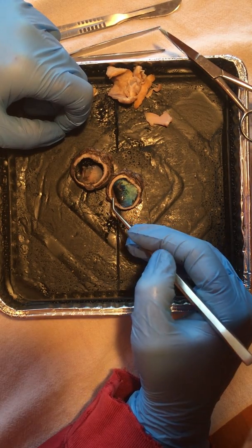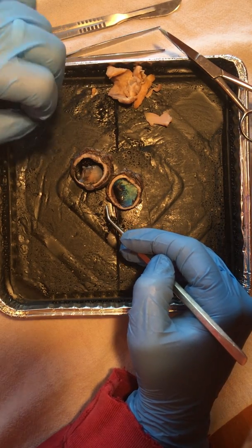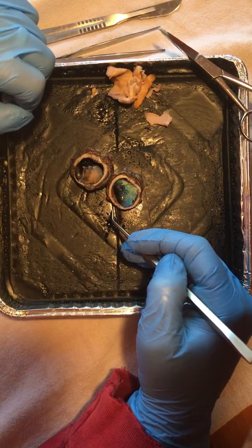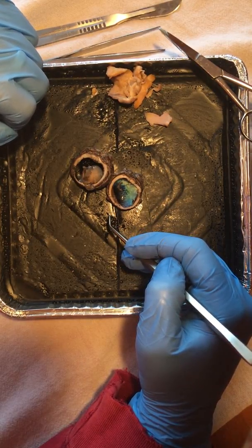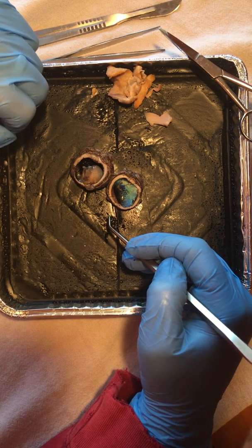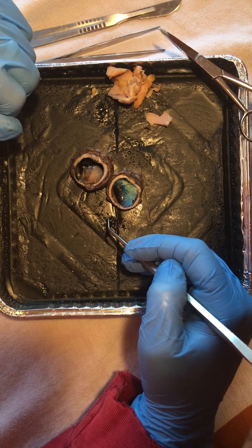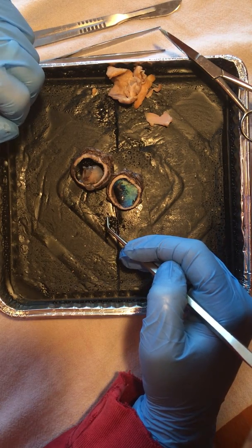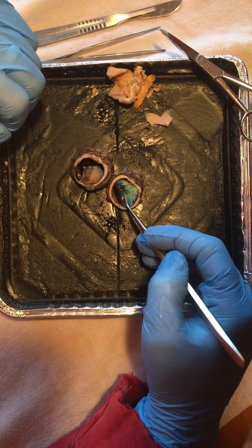And if you recall rods and cones, those are the receptor cells, the bundle of nerves that makes up this retina. Those rods and cones, those receptor cells, are responsible for how we perceive light intensity. The rods, of course, are responsible for more dim lighting, evening lighting, while the cones are more responsible for color and the daylight.